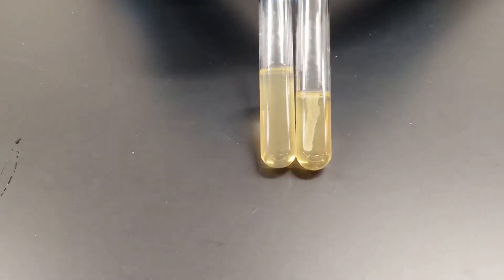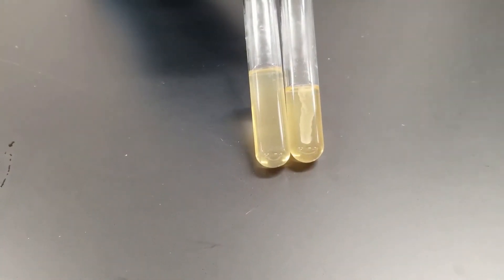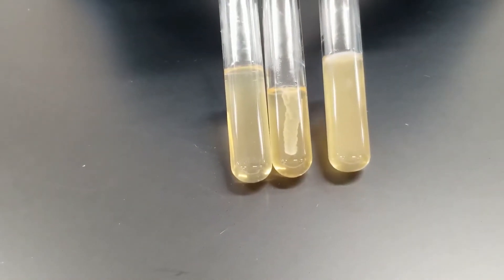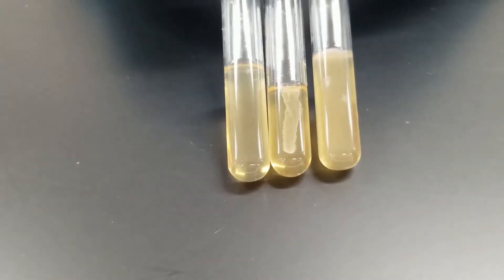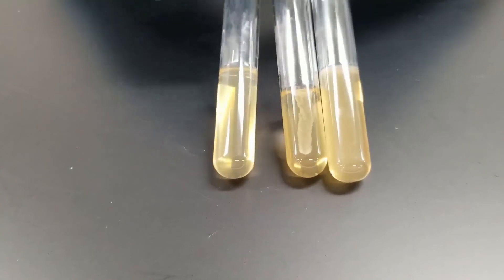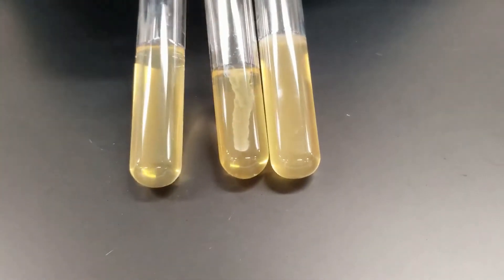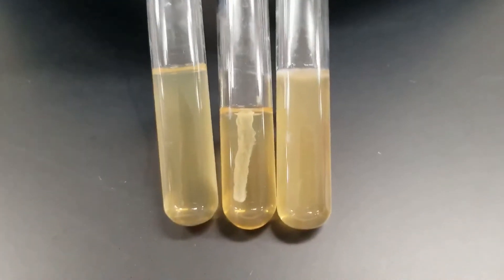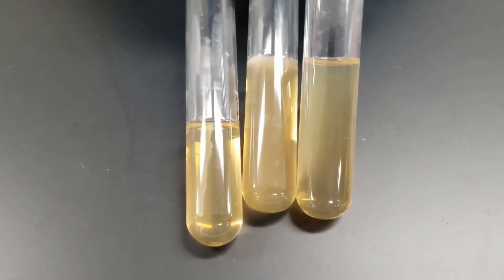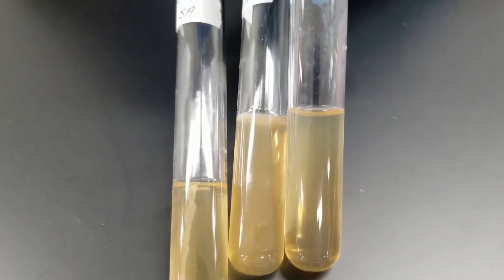This is Staphylococcus aureus — see how the growth is. This new tube is Enterobacter aerogenes. Now, it may be a little difficult to see, but hopefully you can tell that the growth is throughout the entire tube, especially if I move the un-inoculated tube to the end and notice the difference in the coloration.